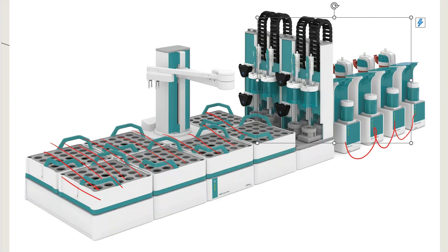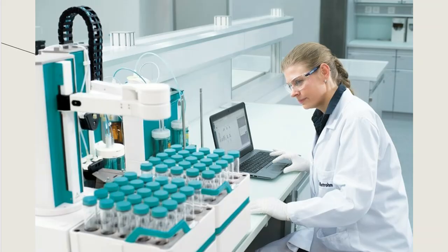What you're going to see with us are very basic models that really involve you switching out the samples, keying in information, no auto samplers. You submit one sample at a time to the machine and let it titrate it. You get data and then you move on to the next. But like this woman is using here, you can load these up with multiple samples and have the system titrate throughout the day for you automatically, so that you don't have to worry with them.